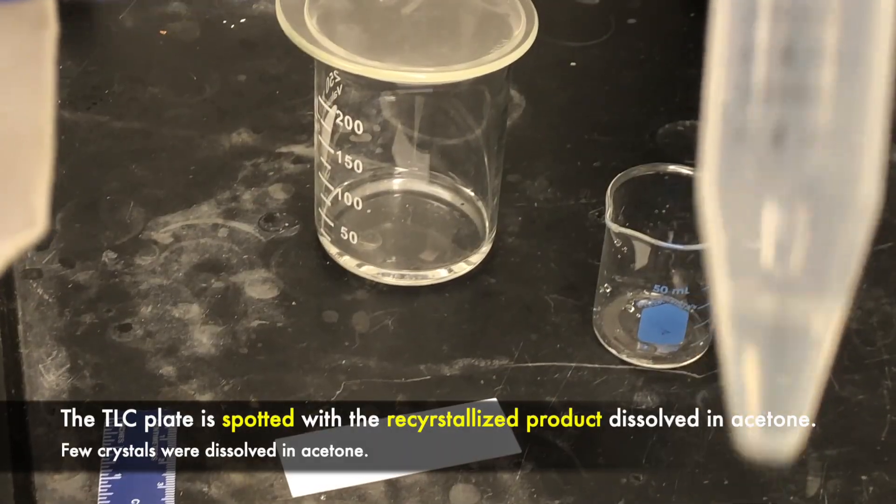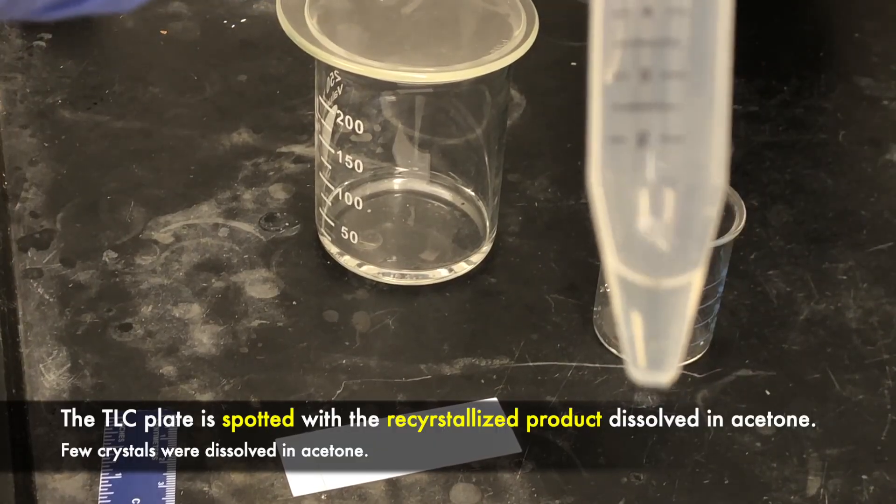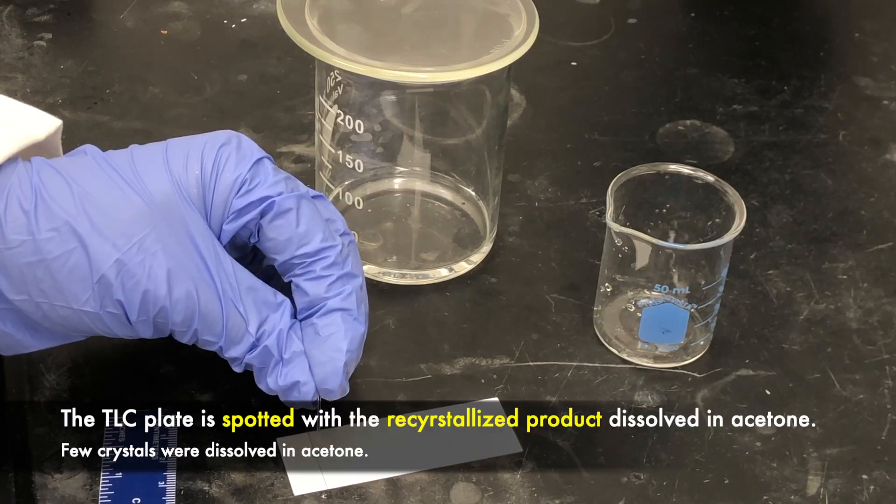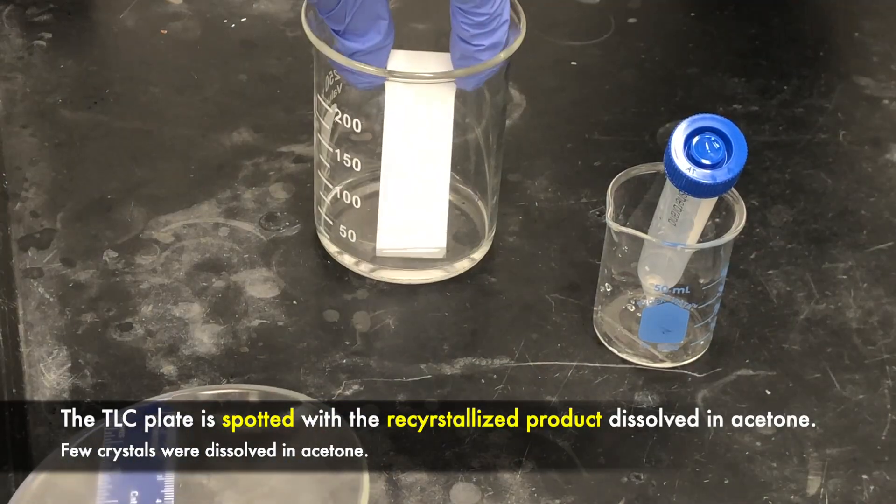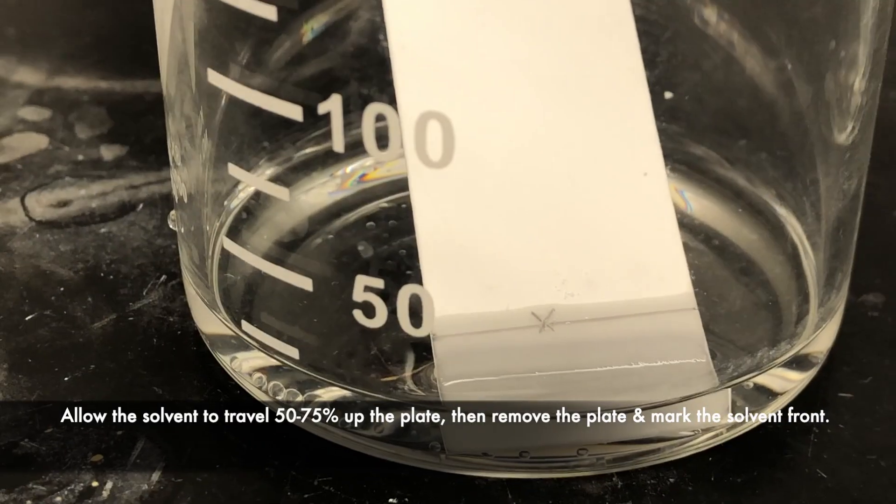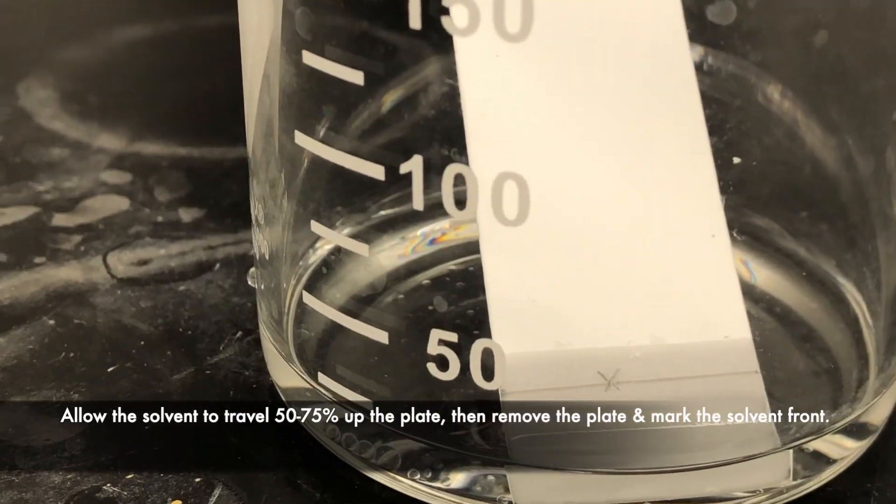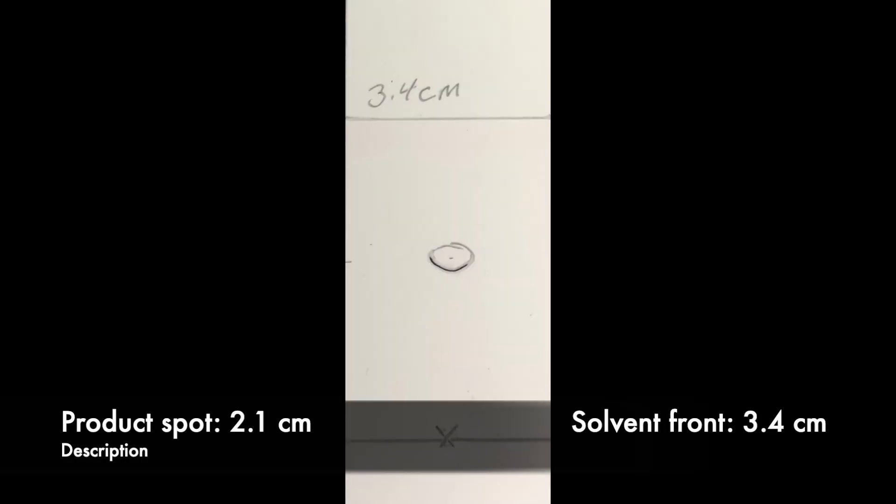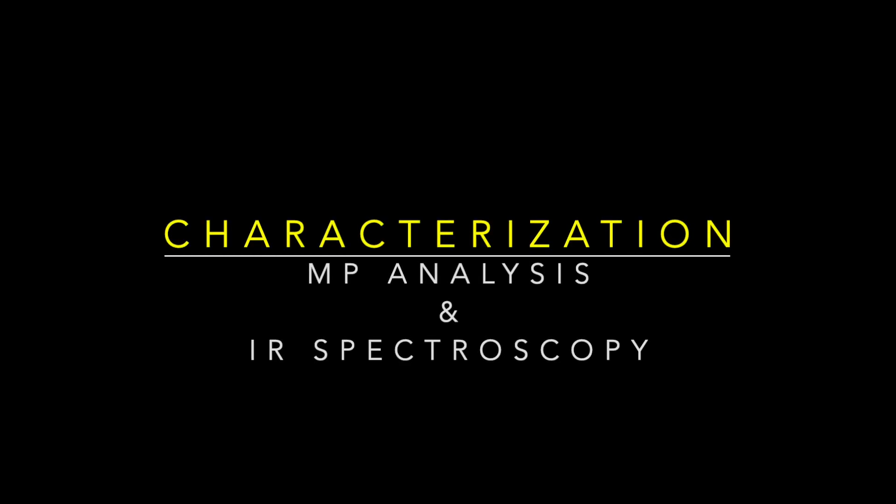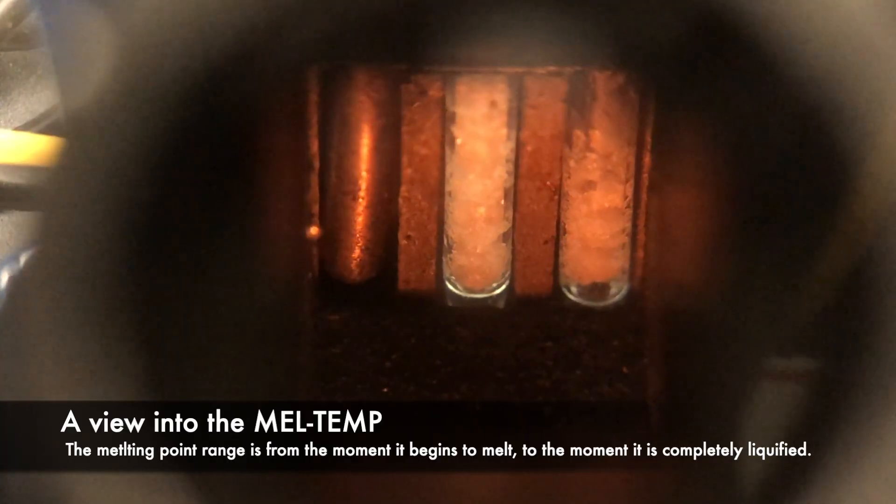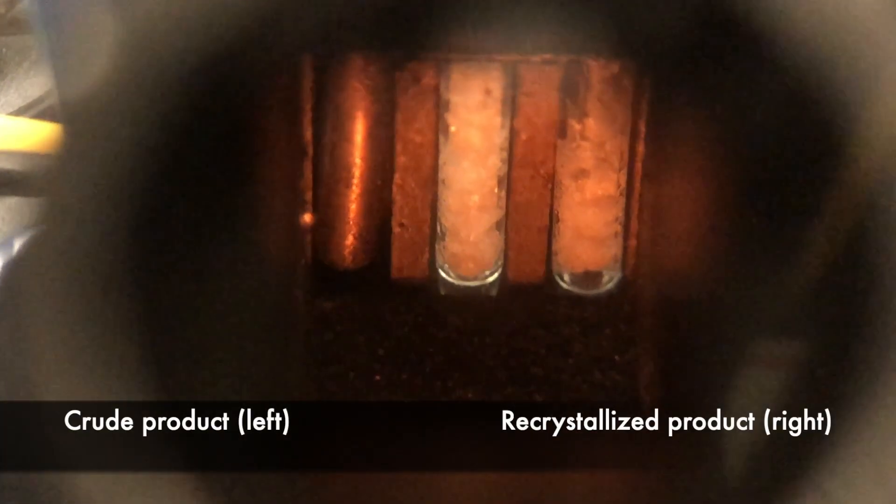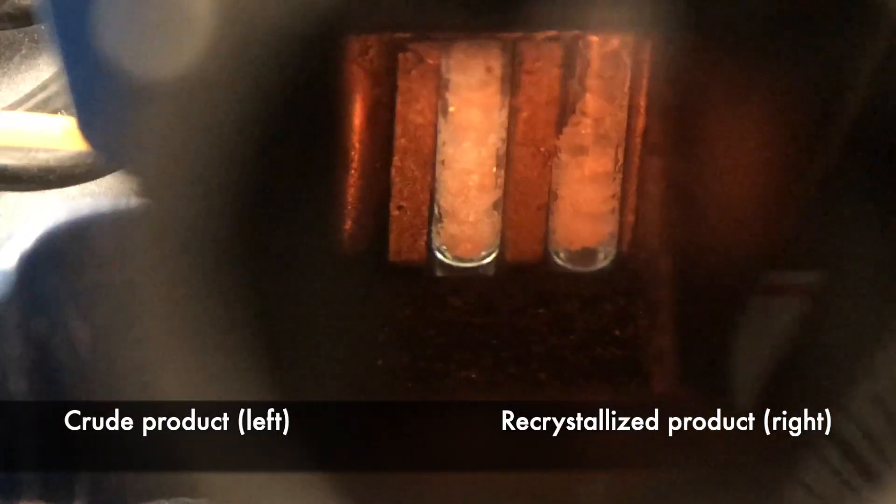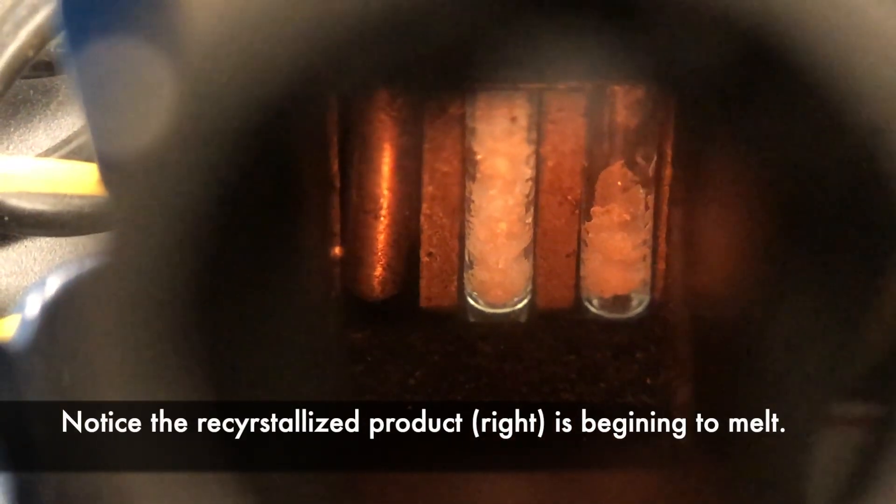I've placed a few crystals of the recrystallized acetaminophen in acetone, and I will use that to spot the product.